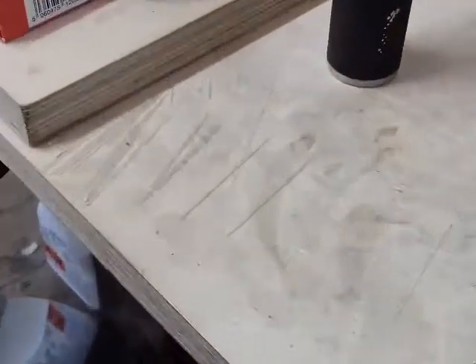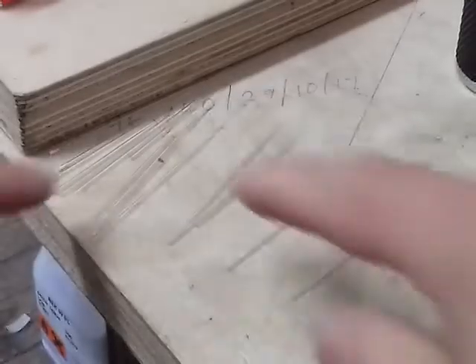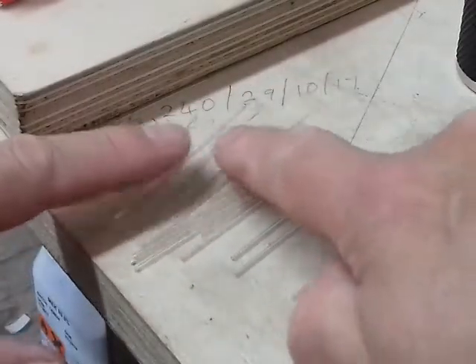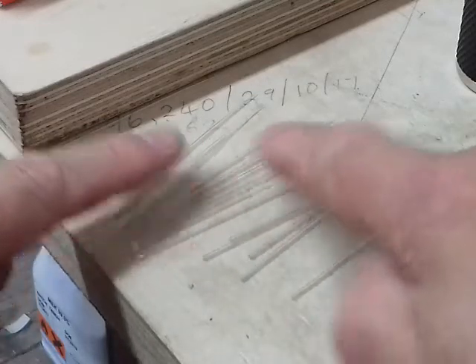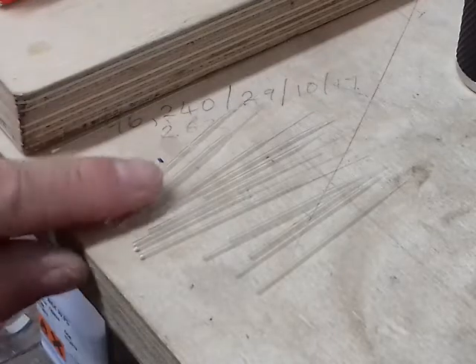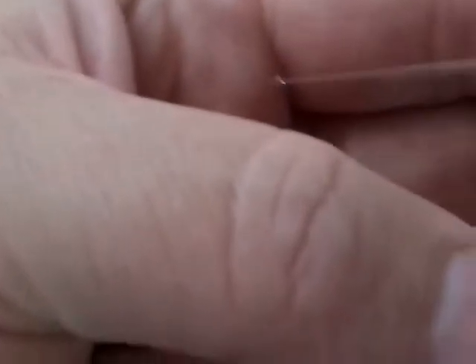gain enough there to keep you going for a while. And all those there are usable, all good. So I've done those in 5 minutes. So I'll give you a closer look at one if I can get it into the camera.